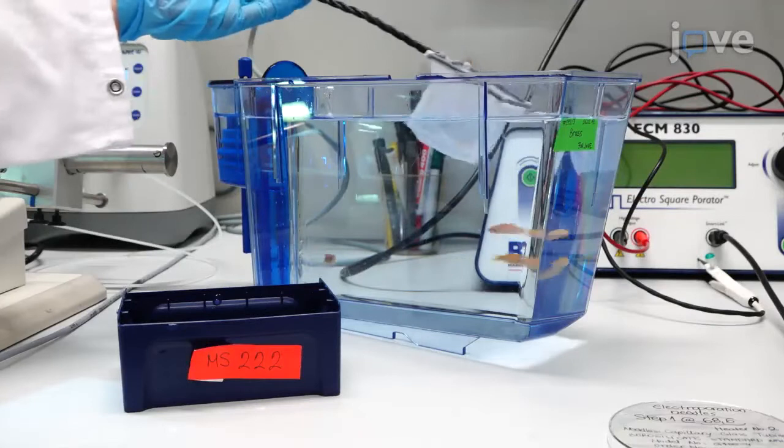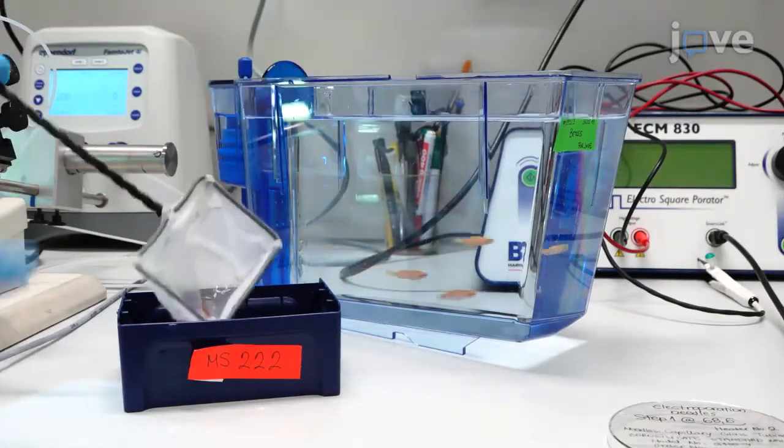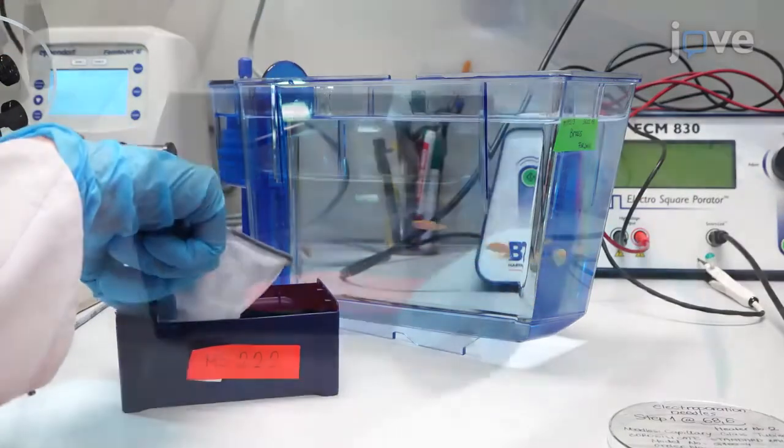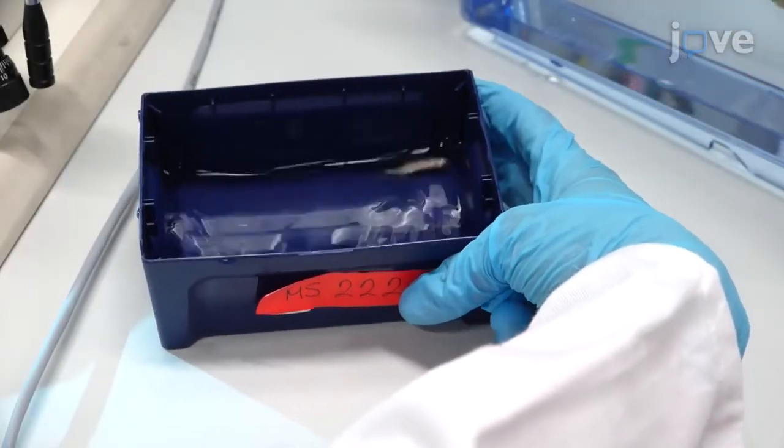When the needle is ready, transfer a zebrafish from the husbandry tank to a container of anesthetic solution, and wait a few minutes until the movement of the gills subsides.